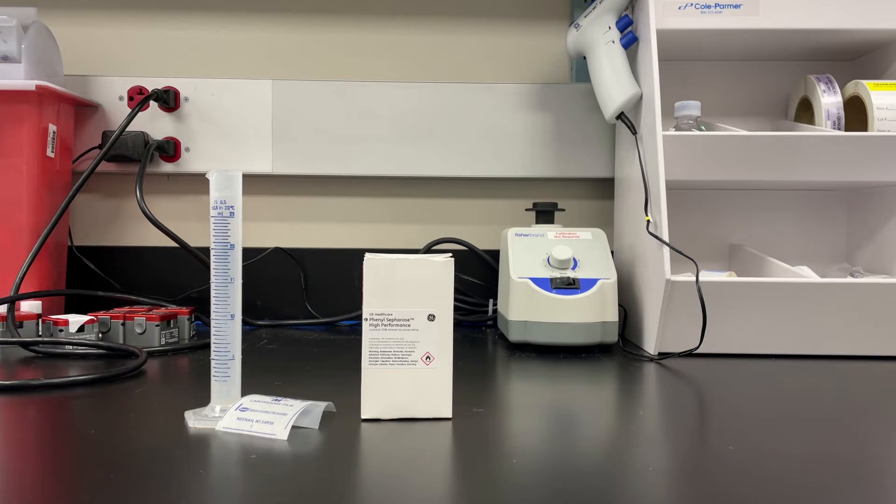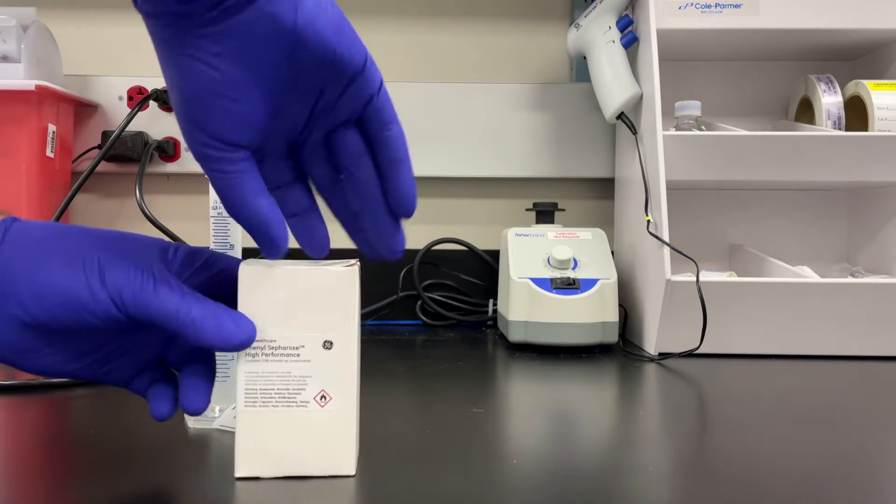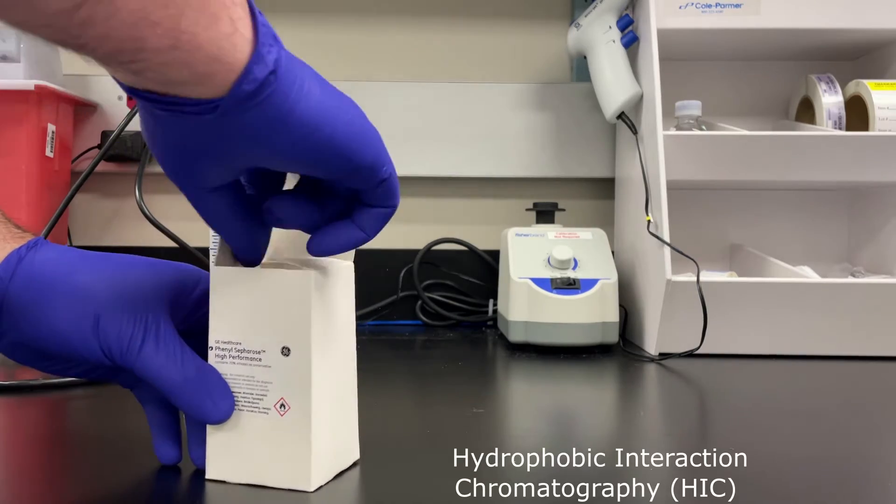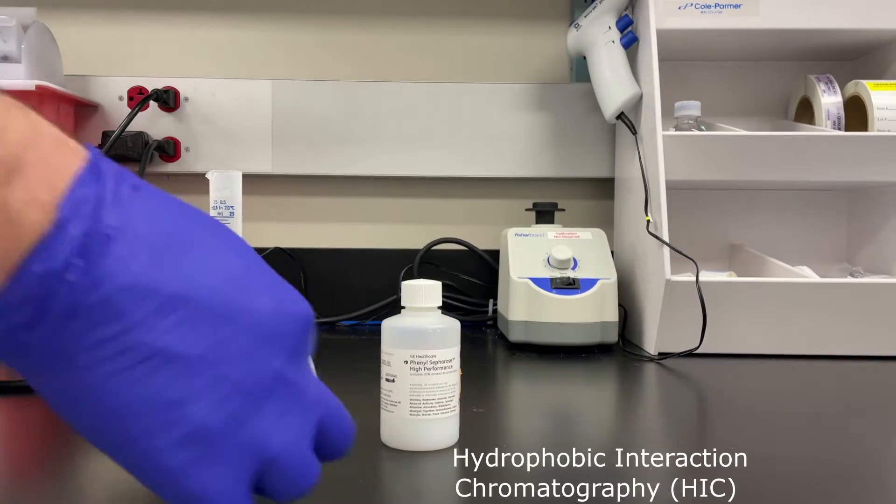Someone suggested in the comments that they wanted me to do a HIC column packing video, so that's what I'm going to do today.